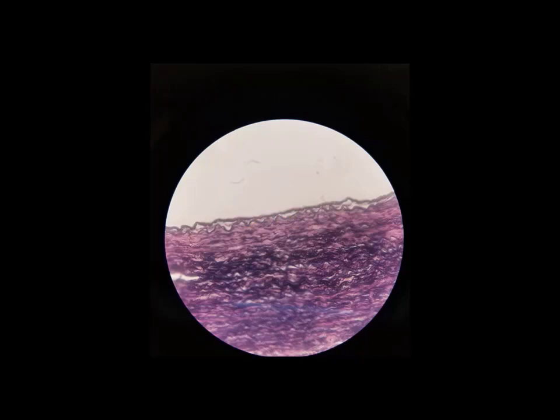This is, again, the wall of the blood vessel, and if we were to stretch the wall of this blood vessel, then instead of having this wavy appearance, those elastic fibers would be straighter. Very similar to like an elastic waistband. If you stretch it, then it can kind of snap right back. And that's exactly what this tissue does in your blood vessels. It allows your blood vessels to expand, and then it brings that blood vessel back to its regular size.